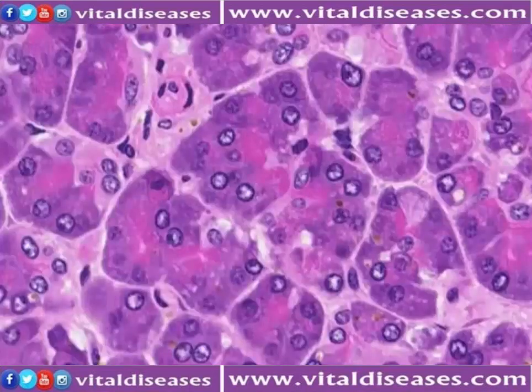First, let's examine the histology of the exocrine pancreas. These triangular, or pyramidal, secretory cells are called acini and comprise more than 80% of the adult pancreas. The nuclei are basally located and the cytoplasm is very granular. The granules differ between the apical and basal cytoplasms, and the granularity is the result of a high density of organelles.